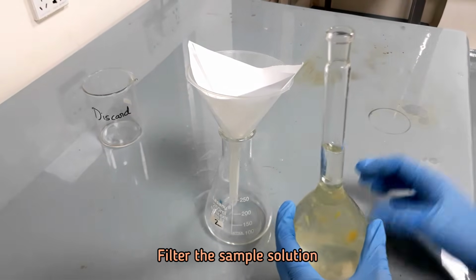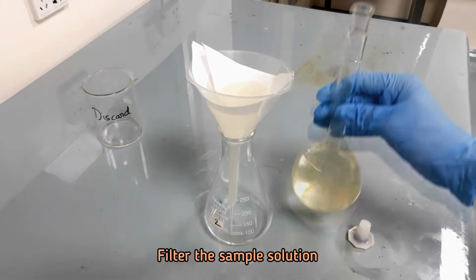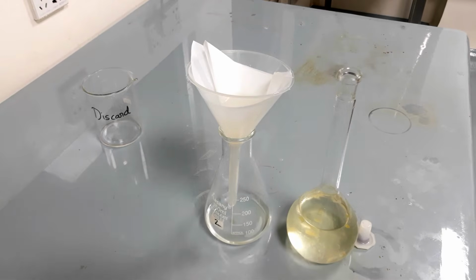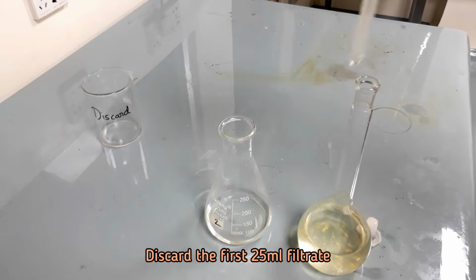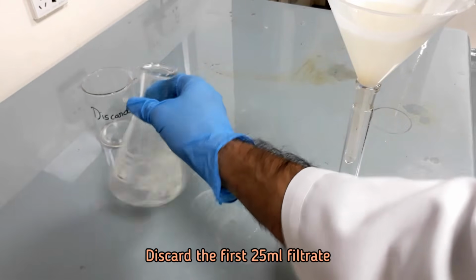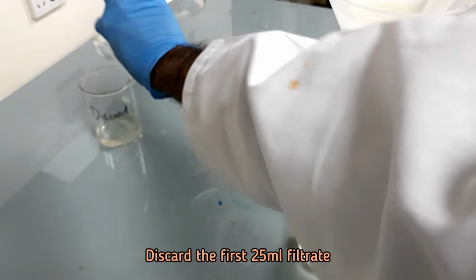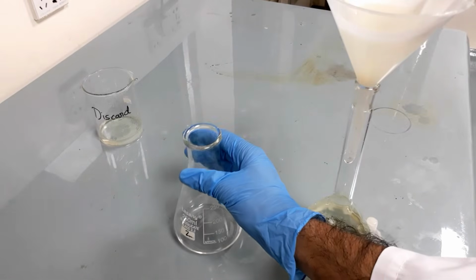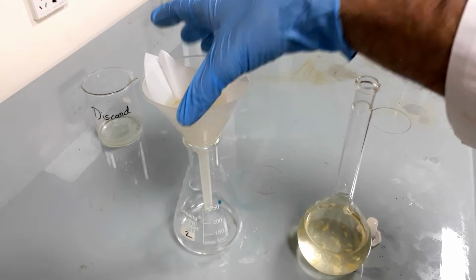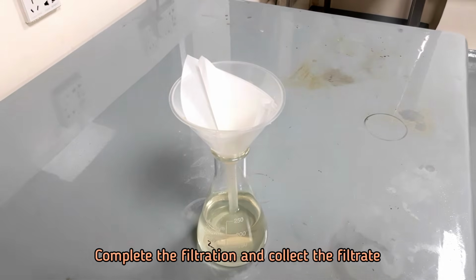Filter the sample solution. Discard the first 25 ml filtrate. Complete the filtration and collect the filtrate.